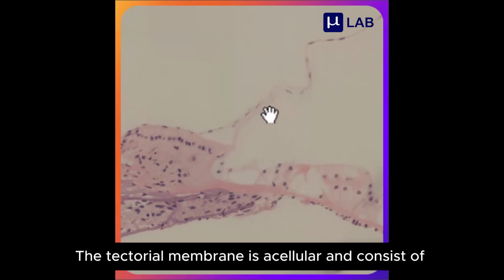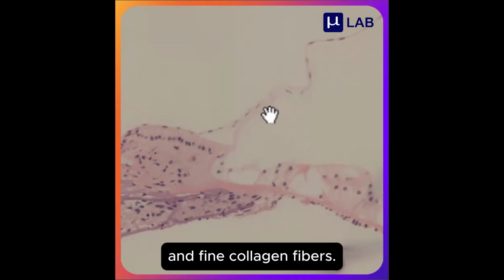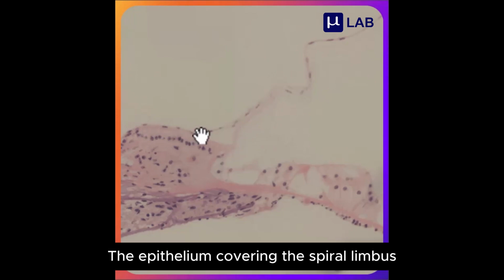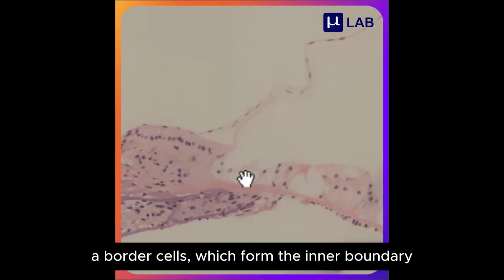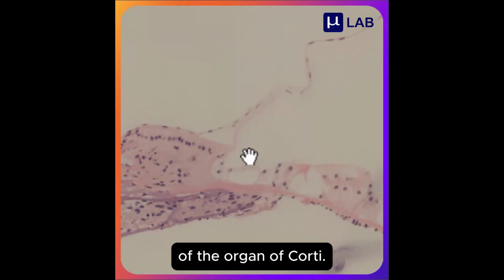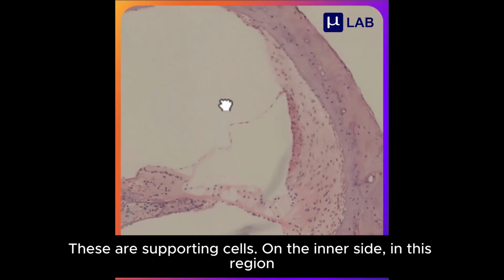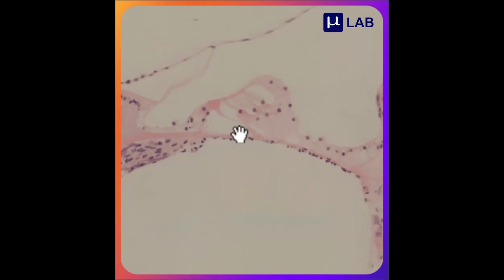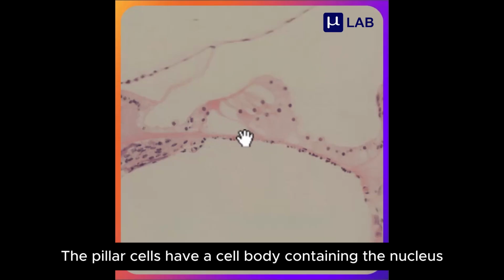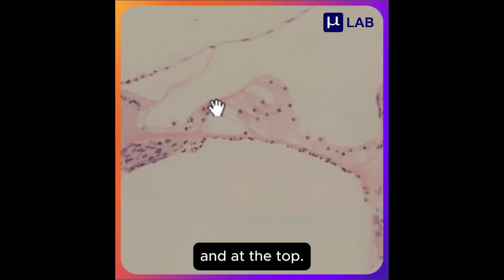The tectorial membrane is acellular and consists of extracellular matrix composed of proteoglycans, glycoproteins, and fine collagen fibers. The epithelium covering the spiral limbus continues and extends as border cells, which form the inner boundary of the organ of Corti. These are supporting cells on the inner side in this region. You can see a triangular-shaped canal known as the inner tunnel. The walls of this inner tunnel are formed by the pillar cells. The pillar cells have a cell body containing the nucleus, and two processes. These processes extend toward each other and connect at the bottom and at the top.